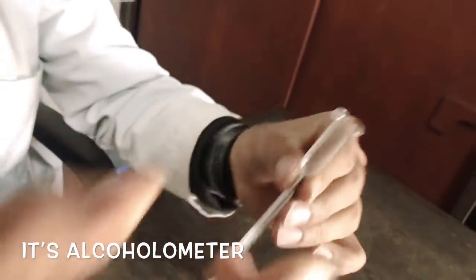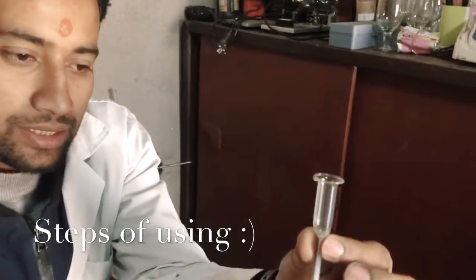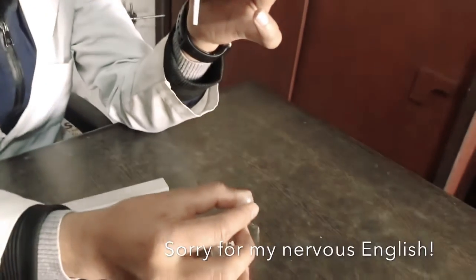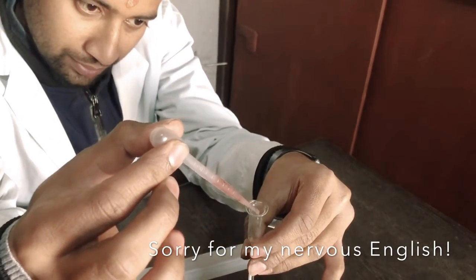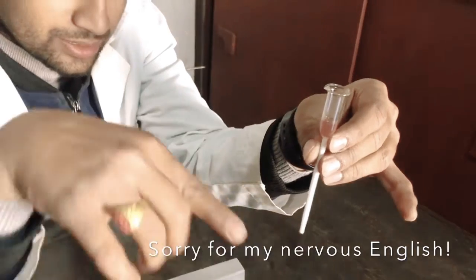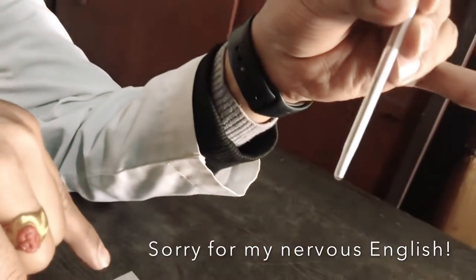The question is how do we use it? We have to hold it in an inverted position like this. And here I am using a dropper so that we can pick up the sample wine and put it in here — two, three, four, or five drops. Then we have to wait for the wine to flow from this side, like one or two drops, this way.